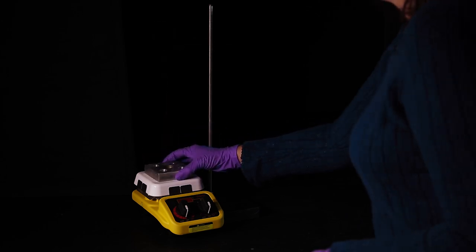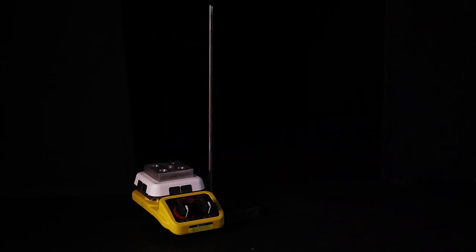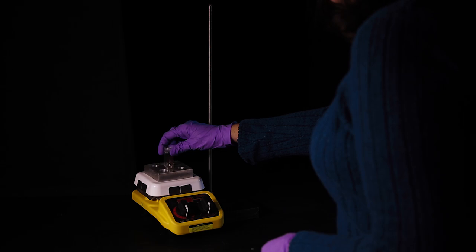Place the aluminum block on top of the hot plate. Place the 5 milliliter conical vial in one of the openings of the aluminum block.